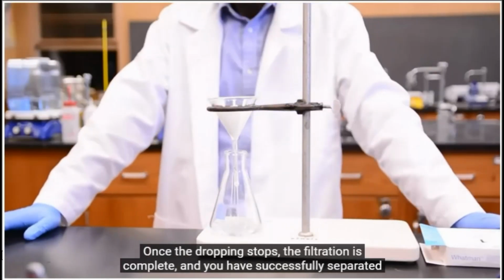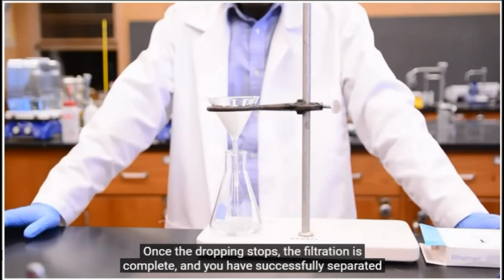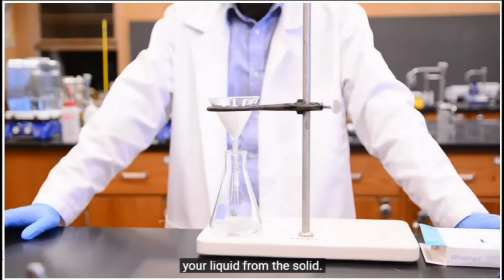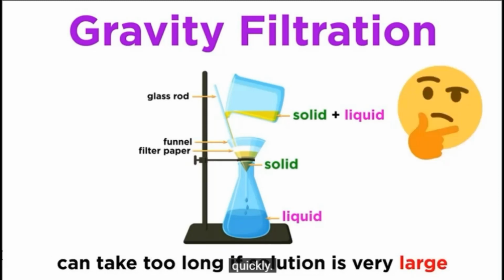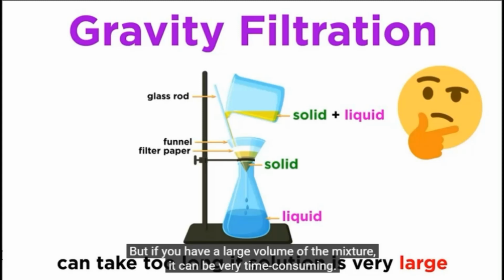Once the dropping stops, the filtration is complete and you have successfully separated your liquid from the solid. Gravity filtration is a great way to separate small mixtures that go through the filter quickly, but if you have a large volume of the mixture, it can be very time-consuming. This is one of the situations where vacuum filtration becomes desirable.